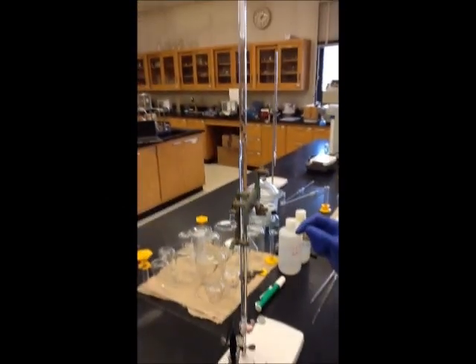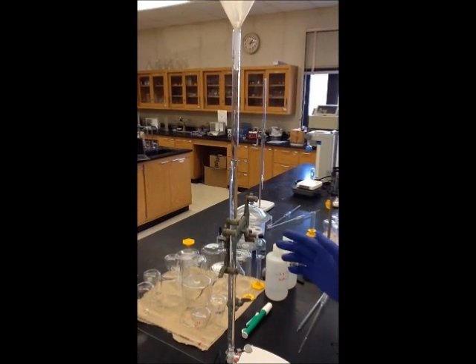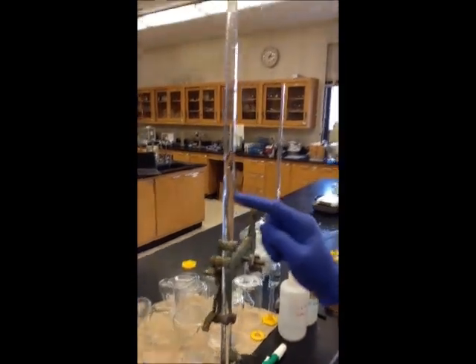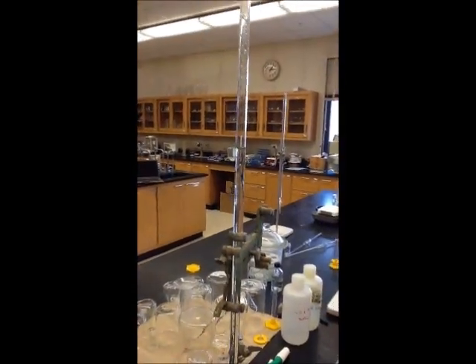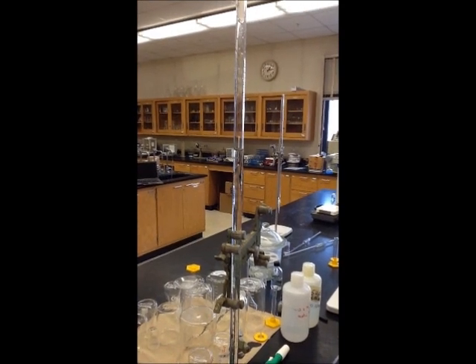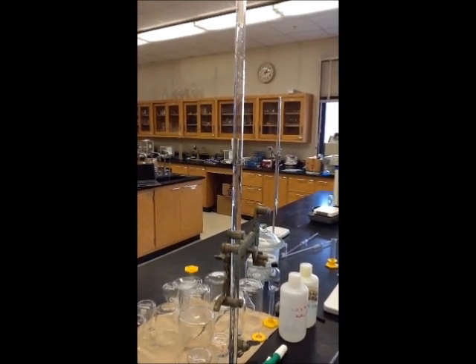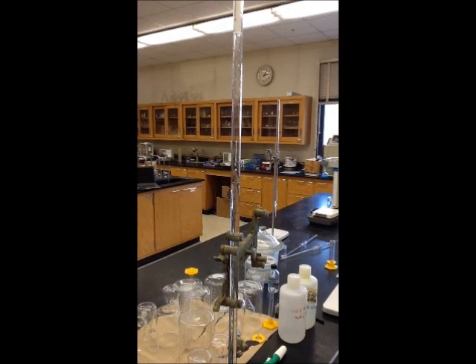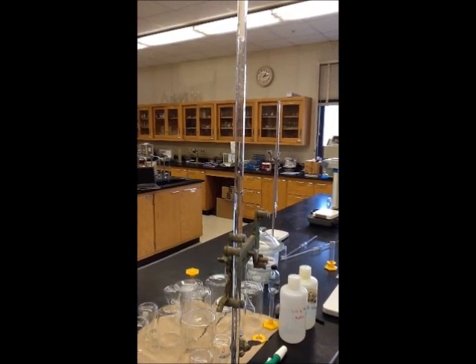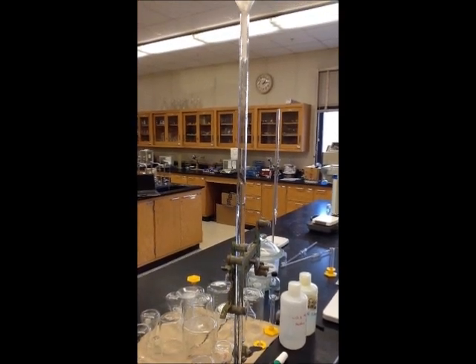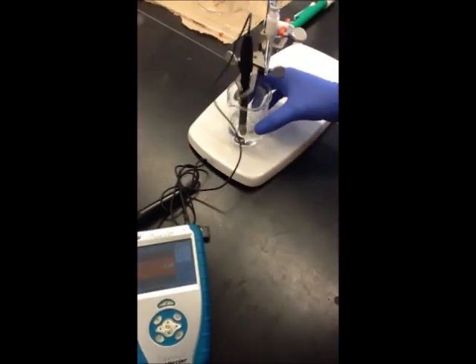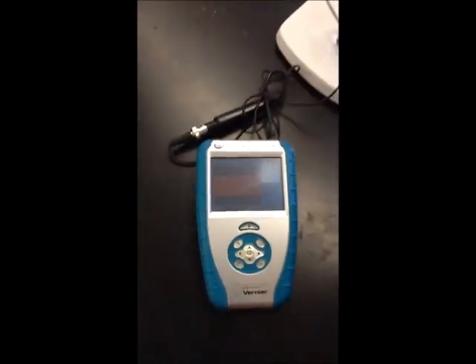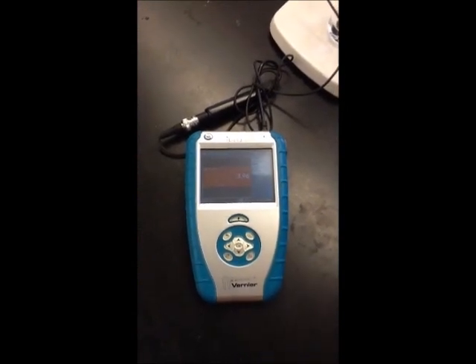Now we are going to add five milliliters of sodium hydroxide. Remember to always read the burette down, so we are going to stop at the 20 mark. And as you can see, our pH after five milliliters has changed to 3.96.